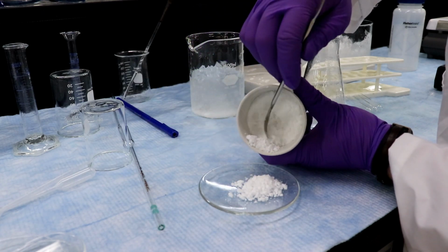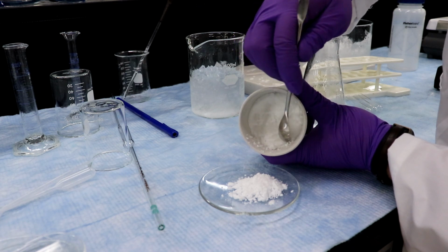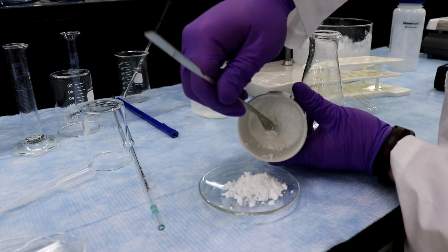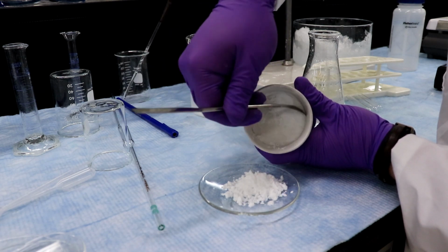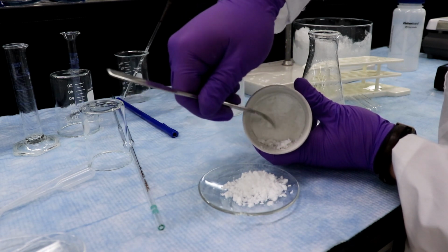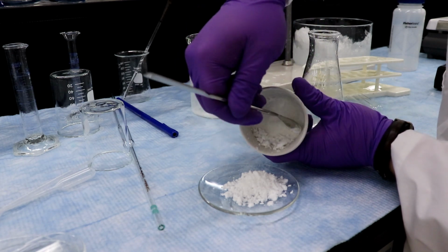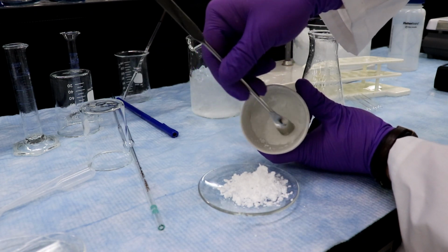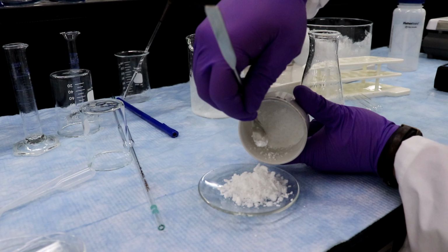And as we start to scrape, we will see the white filter paper underneath. And I'm really not applying any pressure when I'm doing this. I really just want to scrape off what's there. Now, if this was a super expensive synthesis, or something where I wanted to collect every single milligram possible, you'd probably take off the filter paper at this point and dissolve the rest of the product from the filter paper and treat that separately in a kind of recovery step. But this is actually coming off quite nicely.